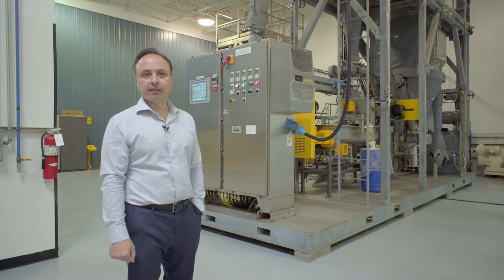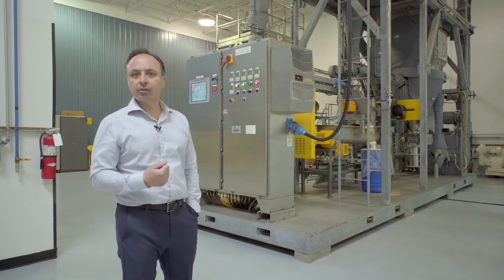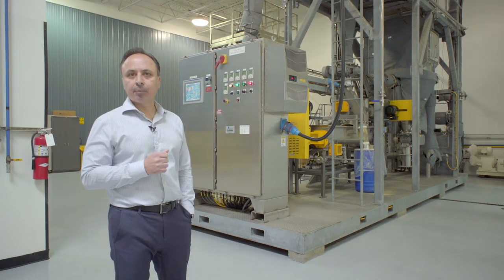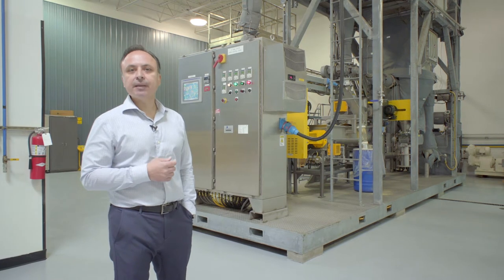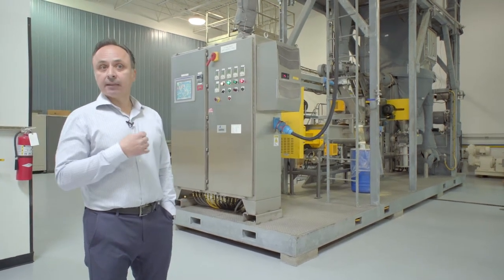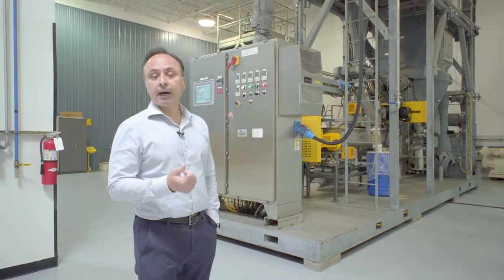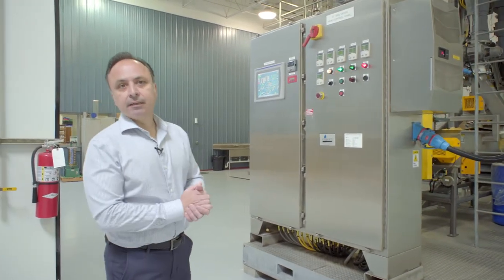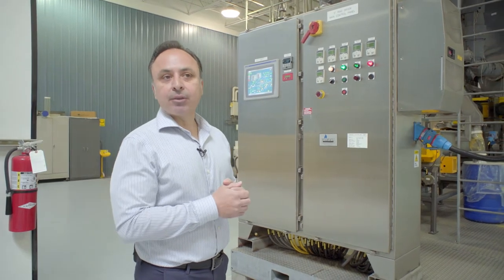Today we're going to look at an overview of the ring drying technology. For those who are not familiar, it is a pneumatic type of dryer where we get the product in and out of the dryer in a mere matter of seconds. The product gets circulated around the system to minimize any thermal degradation at all times. The pilot plant is designed for an evaporative capacity of 150 pounds per hour. The system is controlled by a PLC, which records all parameters and operating conditions, allowing us to successfully design the system to a full-scale production unit.